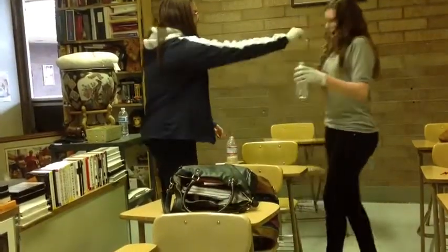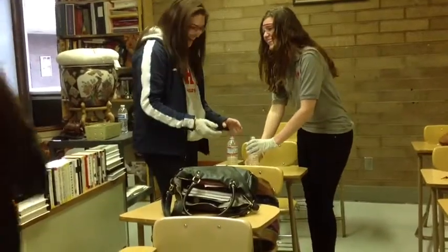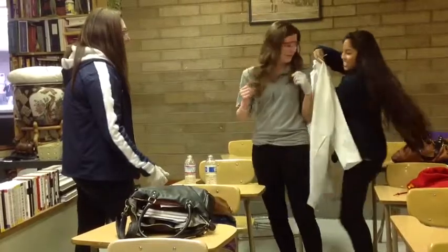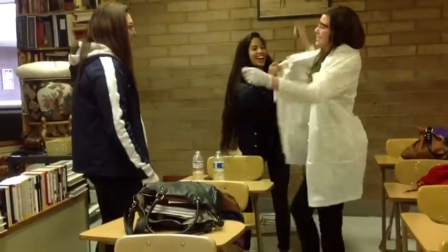While working with chemicals, it is very important to protect your clothes to avoid messes or stains. Lucky for me, Megan came prepared.